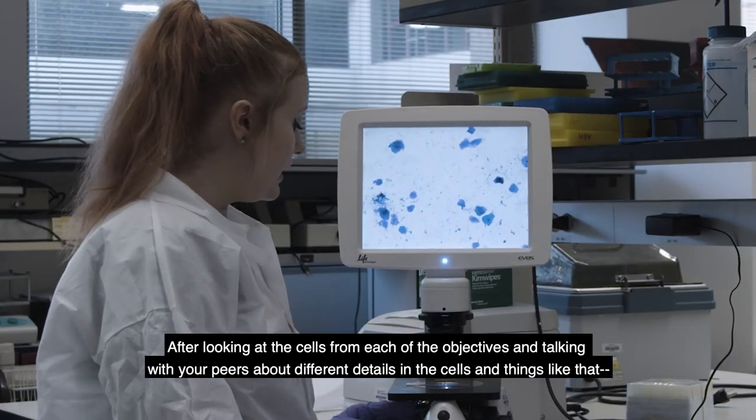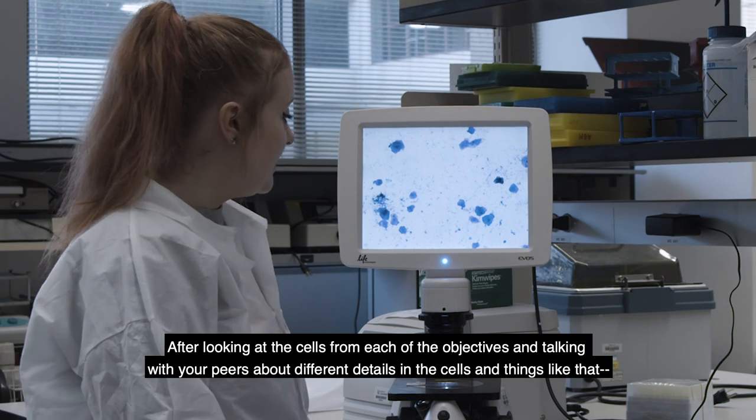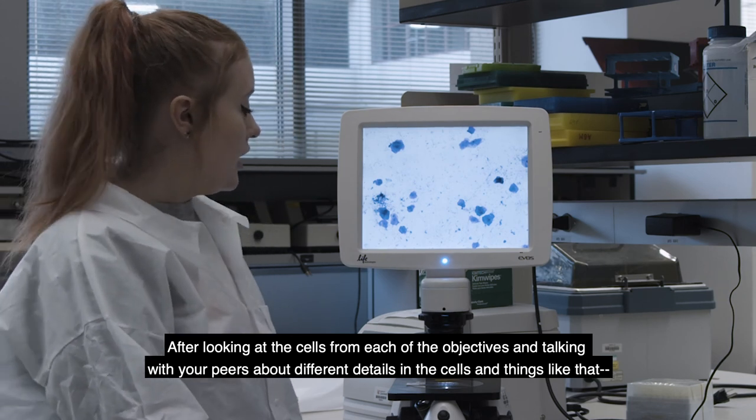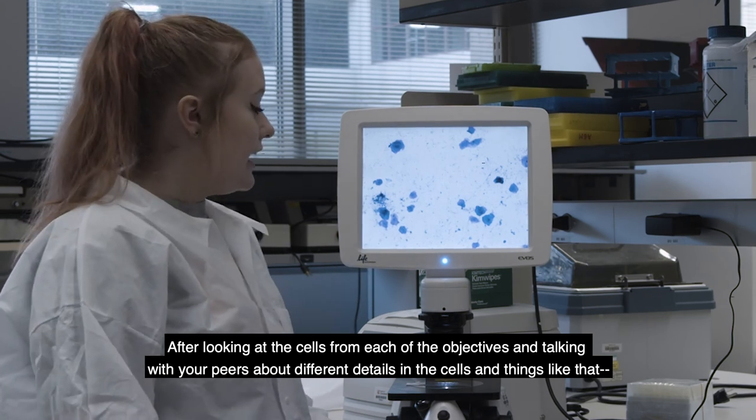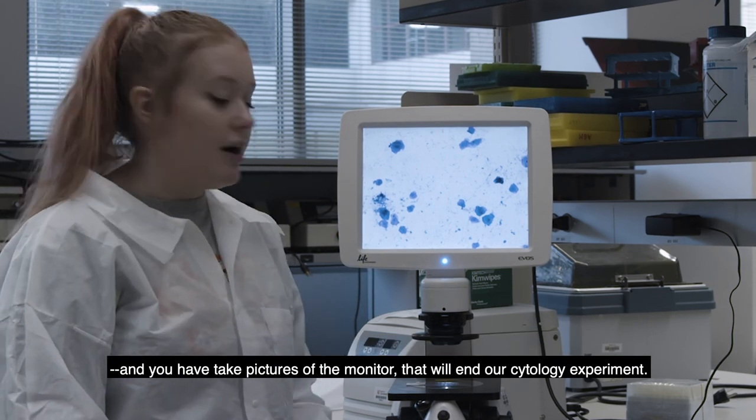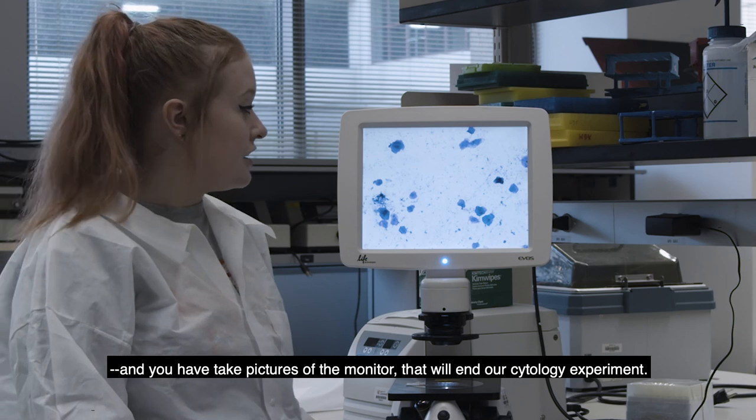So after looking at the cells in each of the objectives and talking with your peers about the different details in the cells and things like that. And you take pictures of the monitor. That will end our cytology experiment.